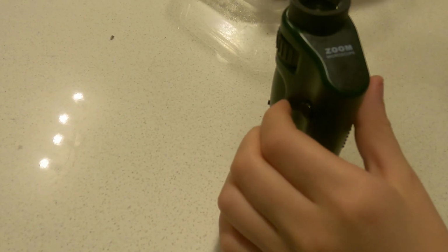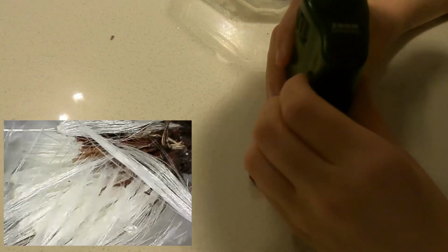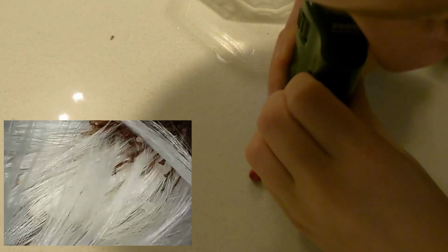Did you look at this dandelion leaf? Oh, no, I have not. Try to grab this dandelion. There should be a whole dandelion in there. Oh, I see one. Well, I found it up here.